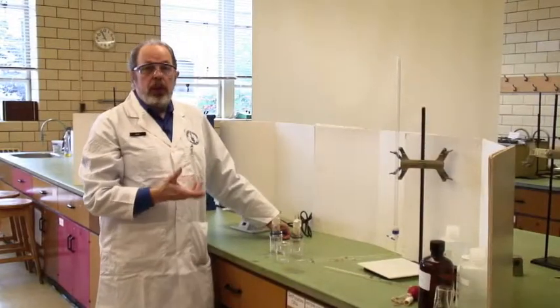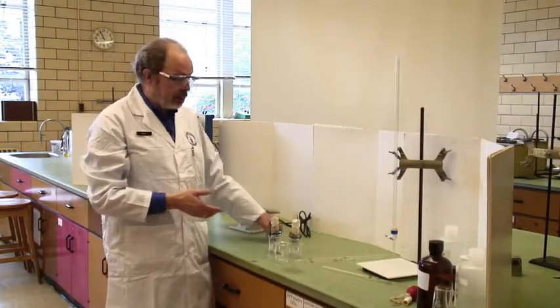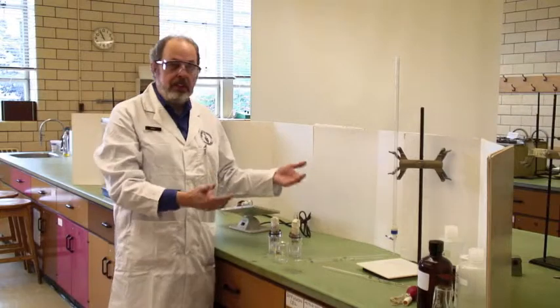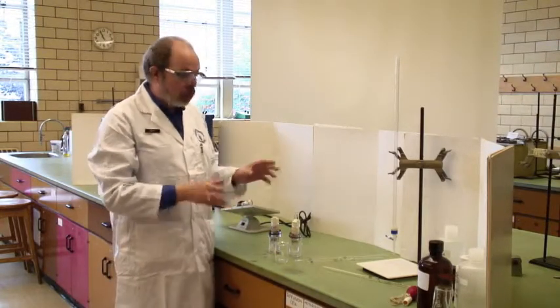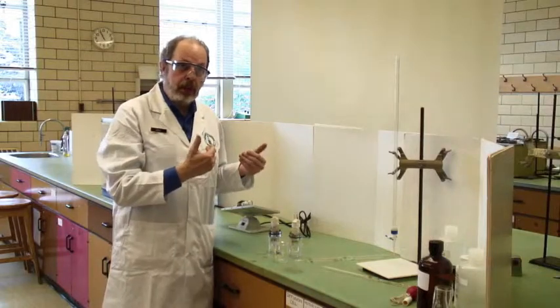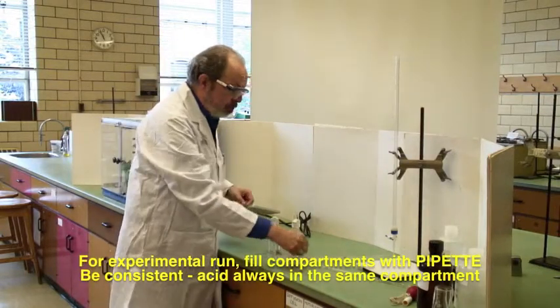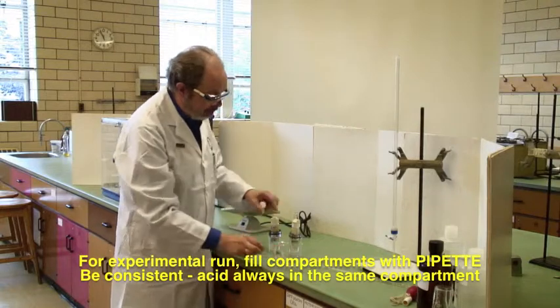You will do that conditioning a couple of times, and when you are finished with that, you just discard the salt solution and acid. However, once you're ready to do an experimental run, you put an appropriate amount, you measure it out by pipette this time, into the cell.